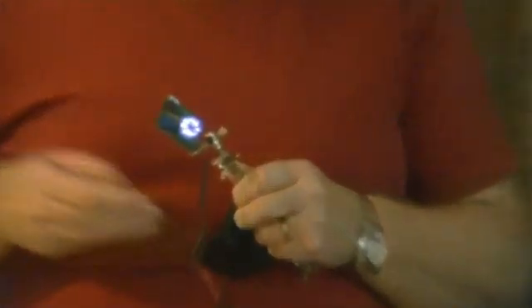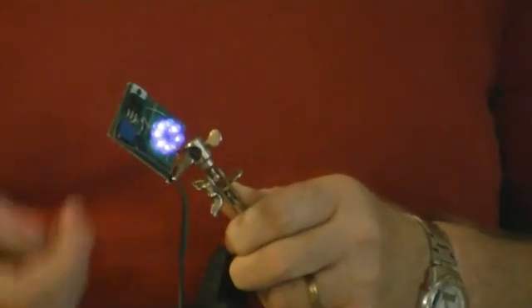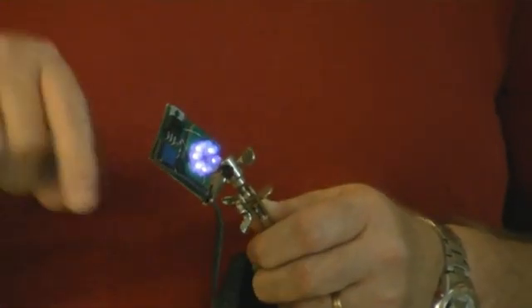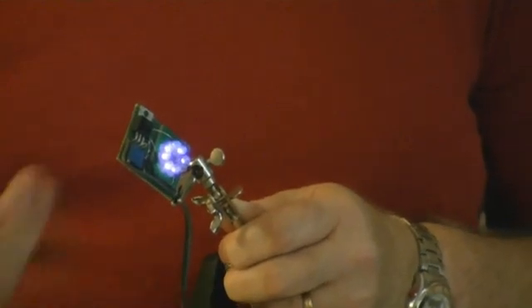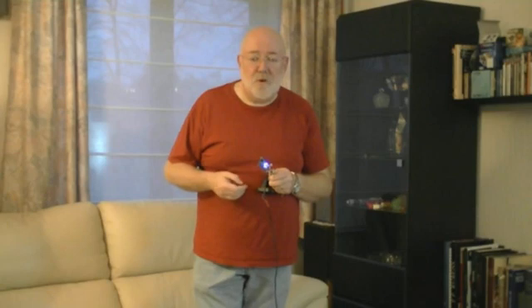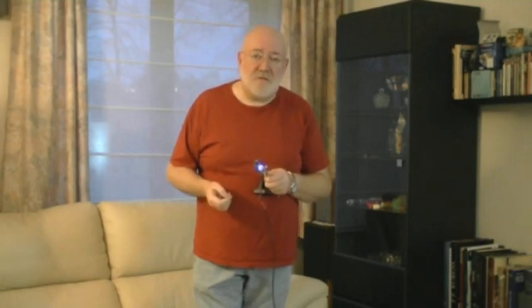We use it with an optical fiber and a collimator lens to collect the signals that we get from the fluorescent minerals. First of all, we need an ultraviolet source to excite our minerals. Personally, I like to use LED sources — ultraviolet or blue light — because they have a very clean spectrum with only one spectral line. If you use mercury vapor lamps, the spectrum of our fluorescent emission gets contaminated with all kinds of spectral lines from mercury.